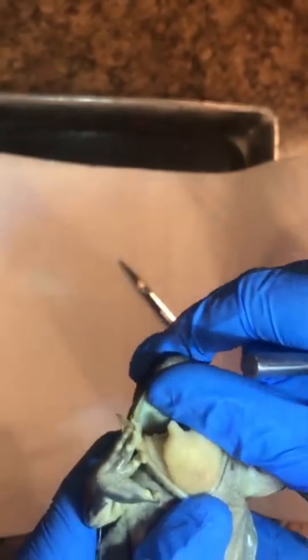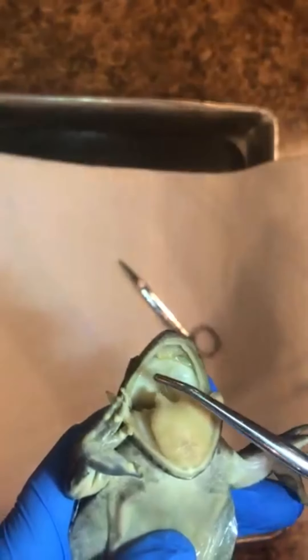Vomerine teeth are located at the very front and center at the roof of the mouth — kind of like little mouse chompers right there. They are very hard and there are only two of them. Along the top of the jawline there are also maxillary teeth — you can't easily see them but you can feel a ridge line running right along the upper jaw.